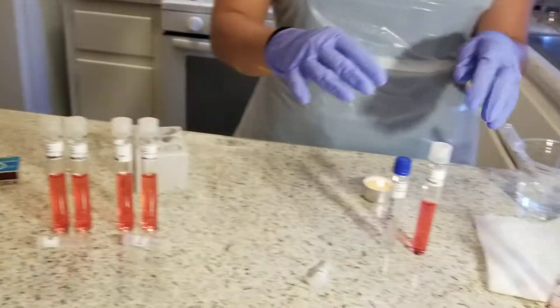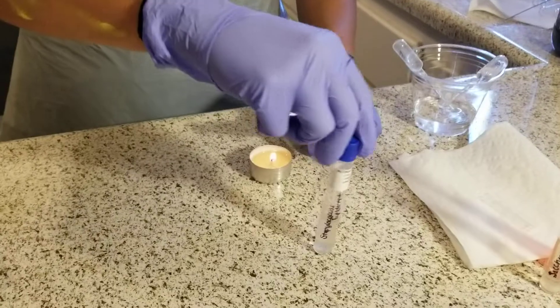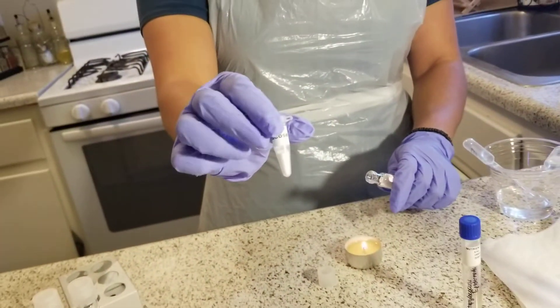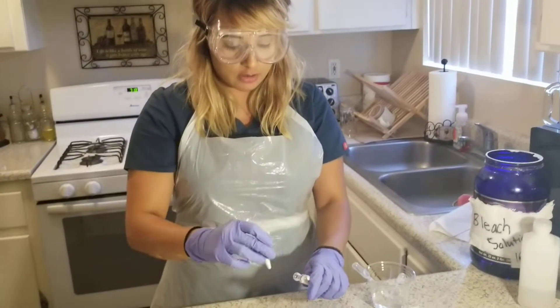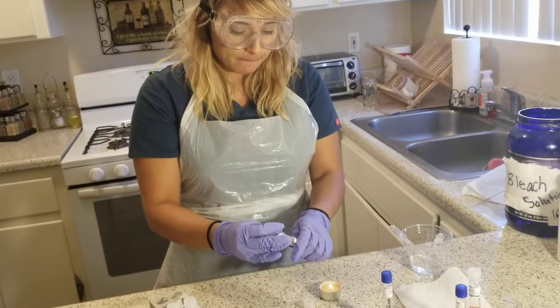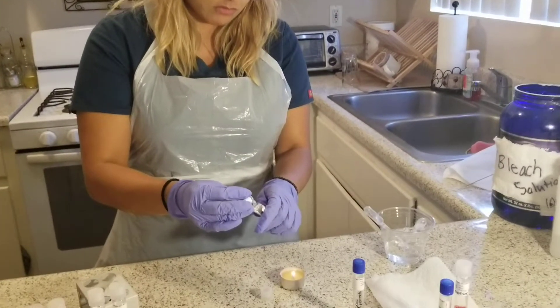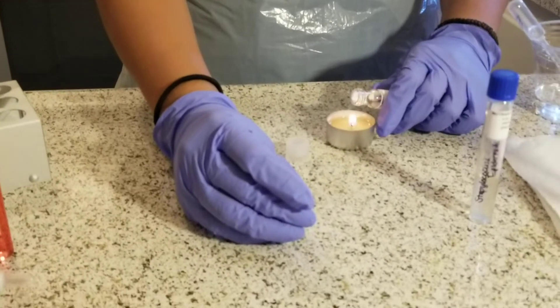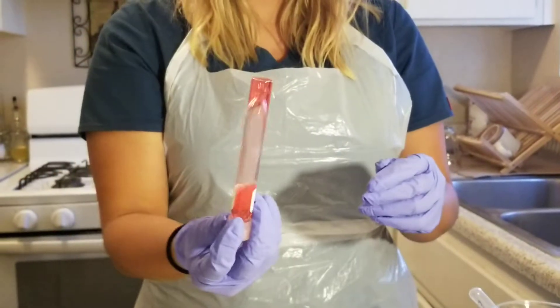I'm going to show you how to do it with the glucose. First, what I'm going to do is take my phenol red vial and put it over the flame to make sure it's sterilized. Then I'm going to grab my glucose powder that has been provided by the lab kit, and I'm only going to put half of this powder into the phenol red broth. I'm going to sterilize the lid and then recap, then shake the broth until the powder is dissolved.